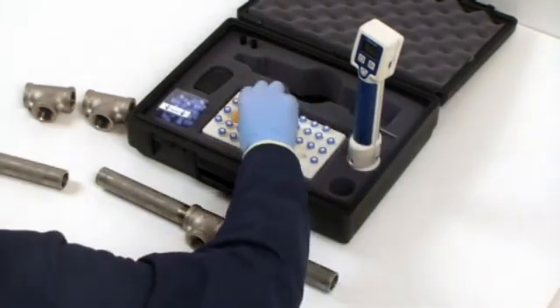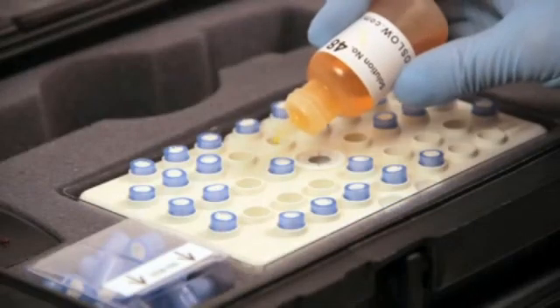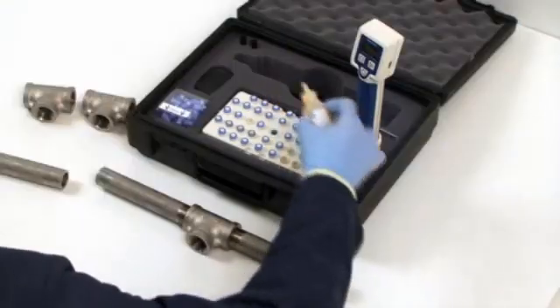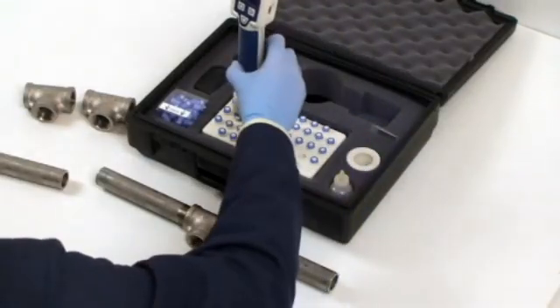If you're doing multiple tests, you can moisten as many nibs as you like at one time. Each nib can be used up to five times.